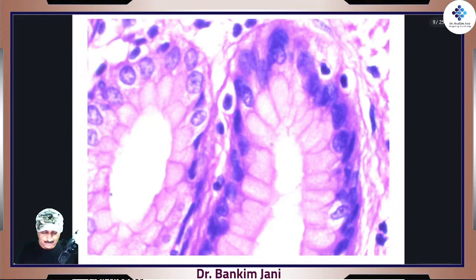See, big ones, right? Some are like this, some are like this. So see the cells. Now you'll see that there is a combination, right? Some of them are elongated, some of them are absolutely round, because this is the cardiac end. So at the cardioesophageal junction, you'll find the mixed pattern, right? Then there are several pathologies associated with it, which we'll discuss when we talk about the esophagus and the stomach.